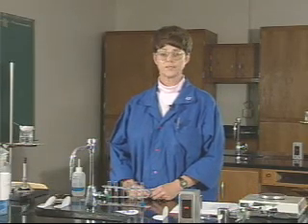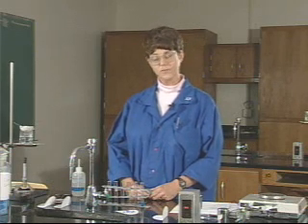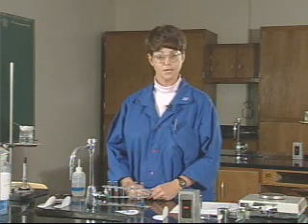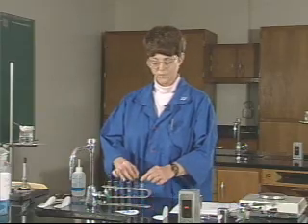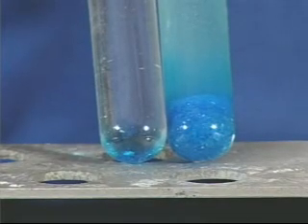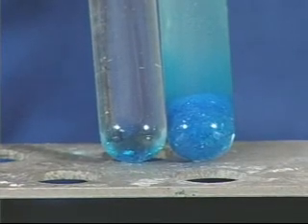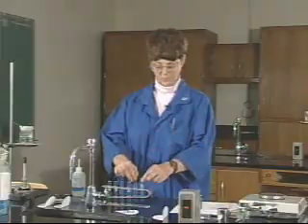You'll then let these tubes stand for a few minutes. After a few minutes, you want to decide which of the two types of material dissolved faster — the powdered one or the solid crystal. Since copper sulfate is a colored solution, one of the ways you'd be able to tell is by the depth of the color. So after a few minutes, look at the two solutions — the powdered and the crystal — and see which one has the deeper color. This will indicate which one dissolved faster.